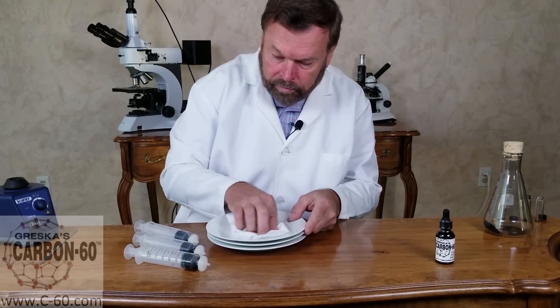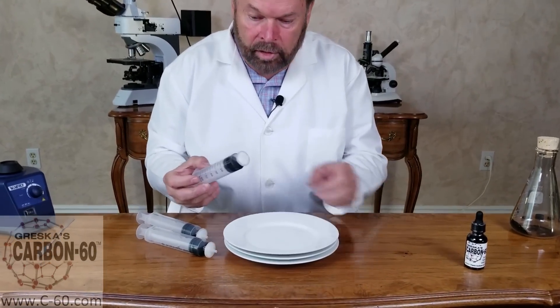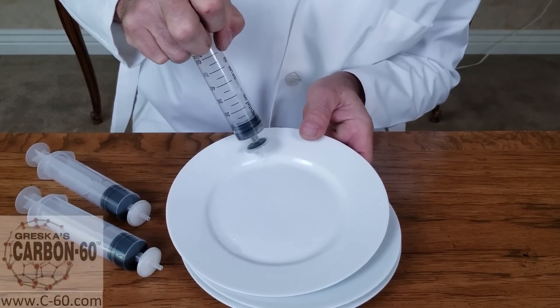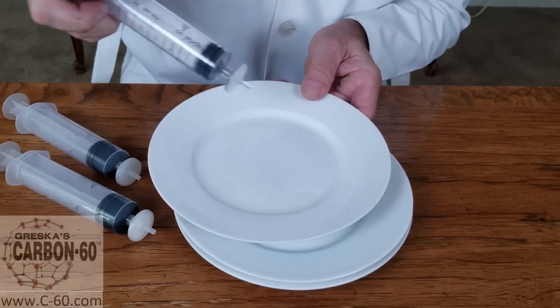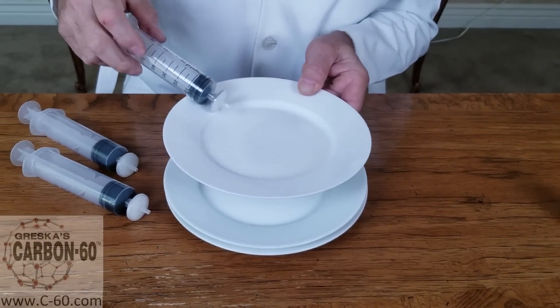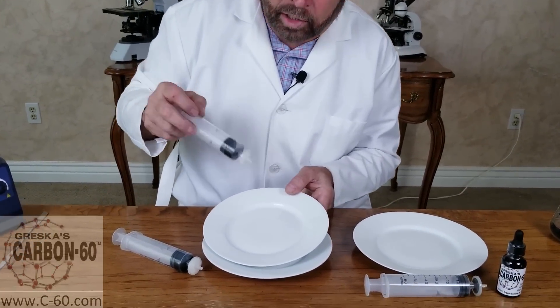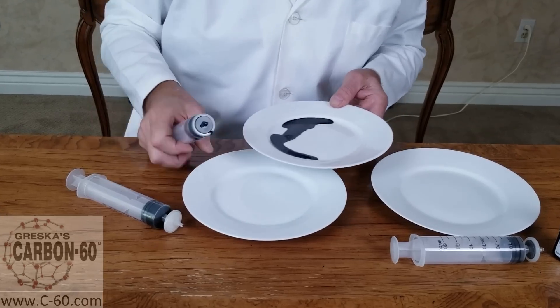We'll show you the first solvent going through the filter — come in a little bit closer here. We'll push this through, and you can see it comes through clear, because the polarity of the solvent makes a big difference in the charge of the particle, the carbon 60. That's number one. Now solvent number two — different polarity, different charge on the particles. Oh, look at that — that just comes through black, black as can be.